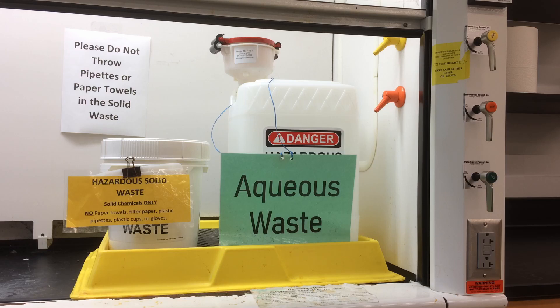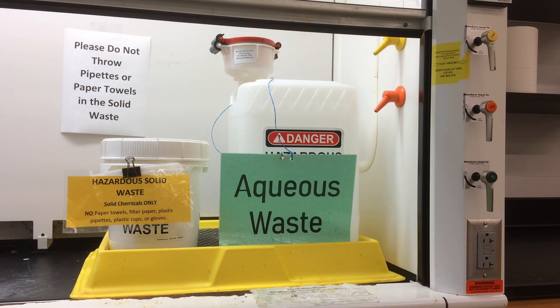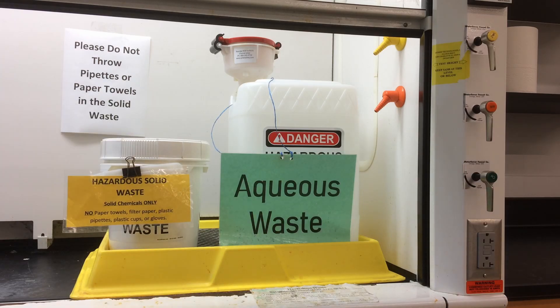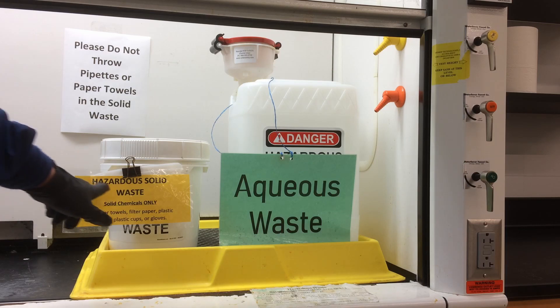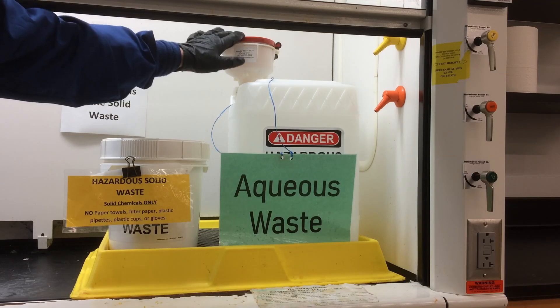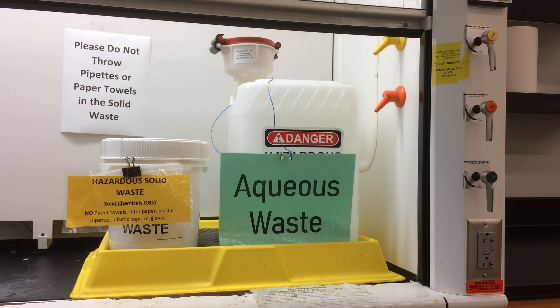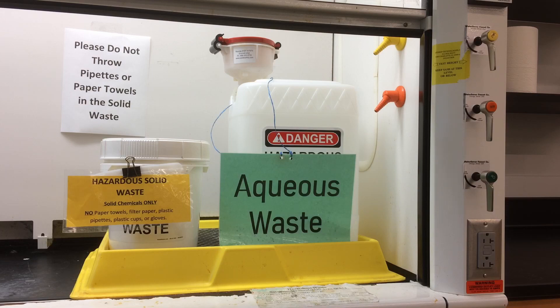The chemical waste containers are stored in the hood as you can see. This is a 5-gallon waste container for liquid waste. This is a 2.5-gallon container for solid waste. This funnel-type cap is used to filter out big objects, something like a stir bar or a piece of paper, from entering the liquid waste.